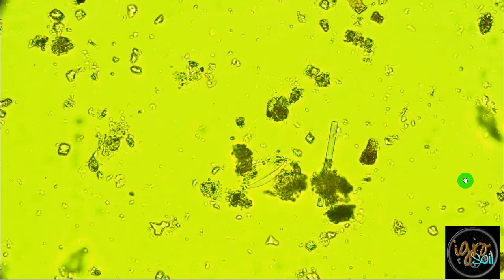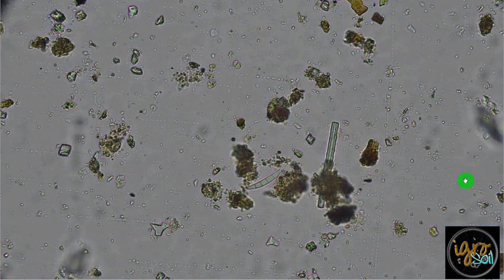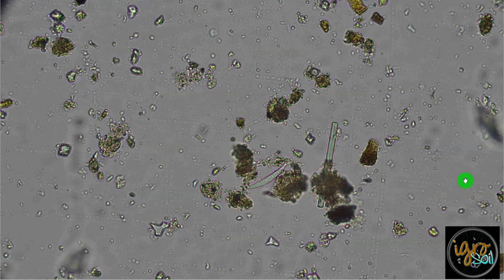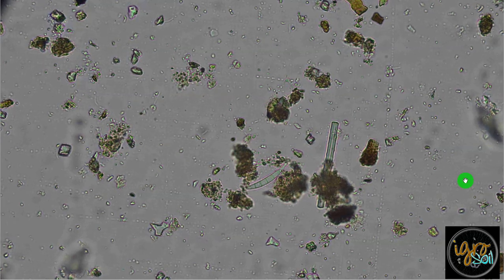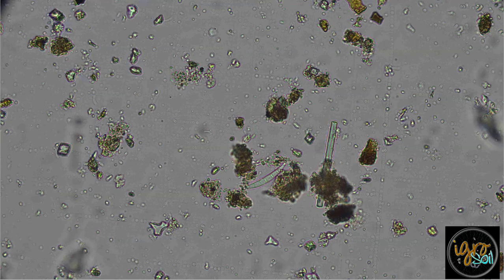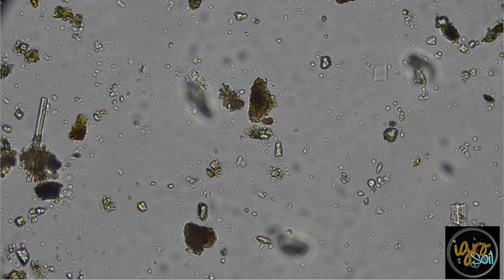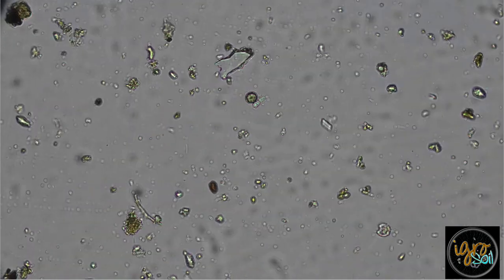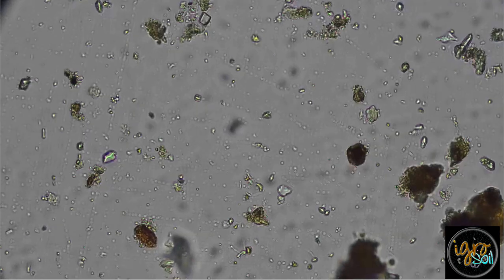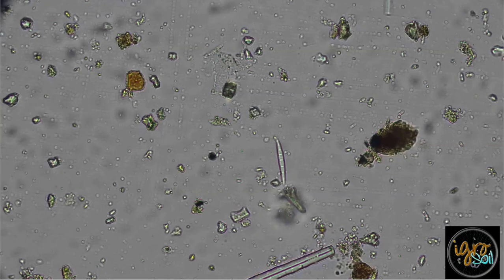Oh, okay. That is extremely symmetrical to not be something. Let me take a picture of that. I'll do some research on that. But again, there's too many there. This is the third slide, and they're present in all the slides. There's another one. See what I'm saying?